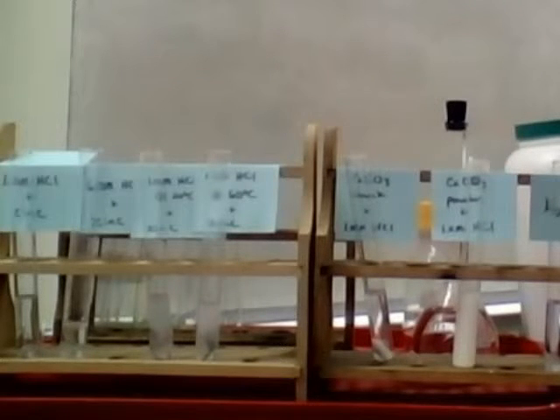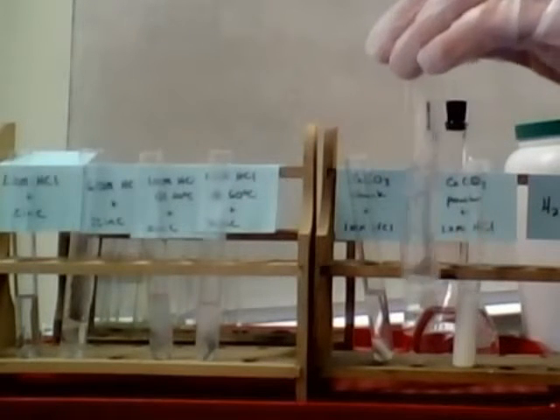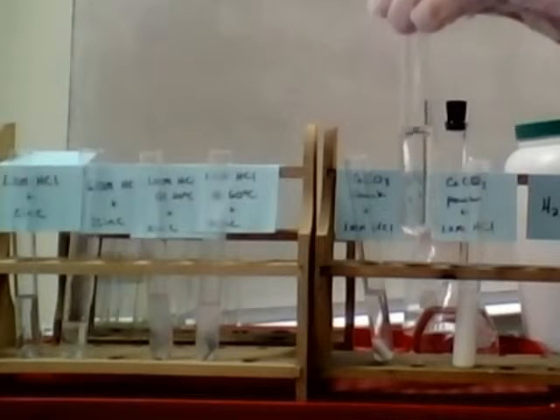So what I'm going to do is put some of the catalyst in here. I'm going to use, instead of MnO2, some yeast, just because it's a little bit easier to clean up. And we'll see what happens. So again, this process of decomposition normally happens very slowly, but now if I put in yeast, a catalyst, if I open the container, that would be helpful. There it is.